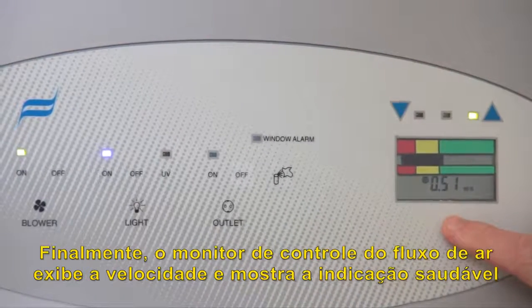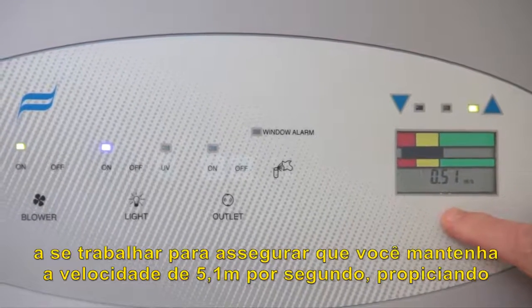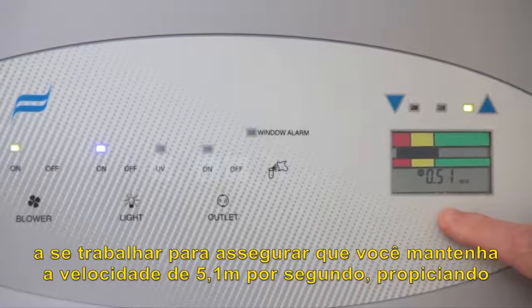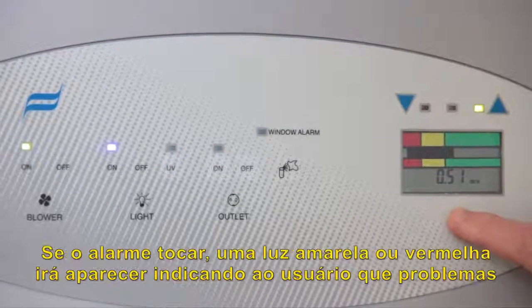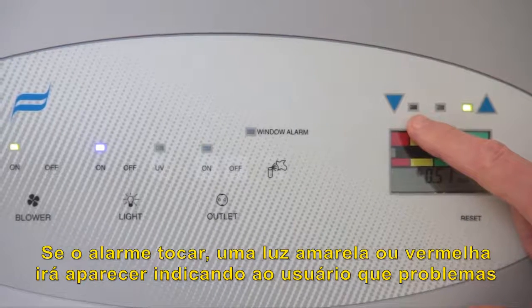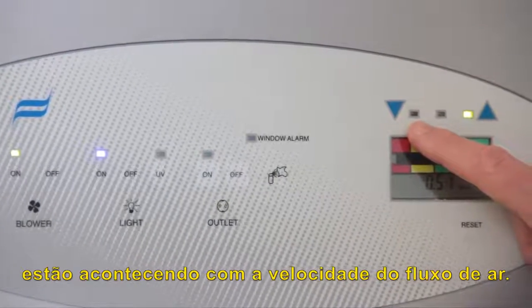The airflow control module displays inflow velocity and tells you the health of the cabinet, to assure that you have the required 0.51 meters per second inflow velocity, providing the safety factor and personnel protection of the equipment. If it goes into alarm, a yellow or red light will appear, indicating to the user that trouble is happening with the inflow velocity of the cabinet.